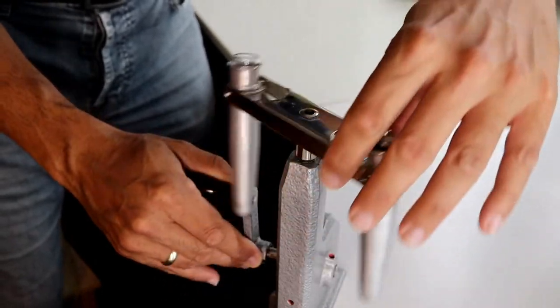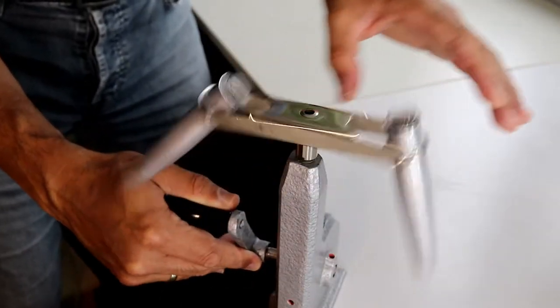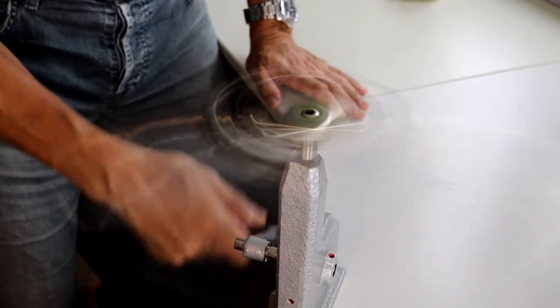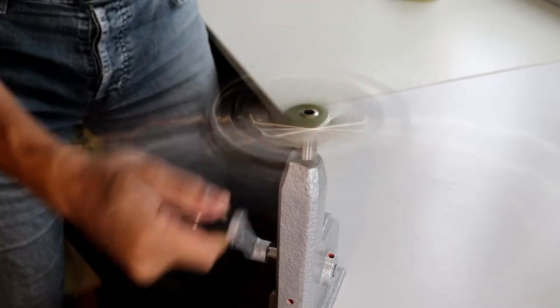And it was a little bit stuck at the beginning, so I had to kind of get it started. And now it's rotating relatively quickly. So as I said, a couple of minutes.